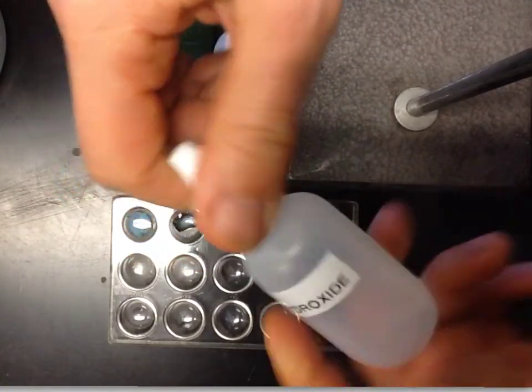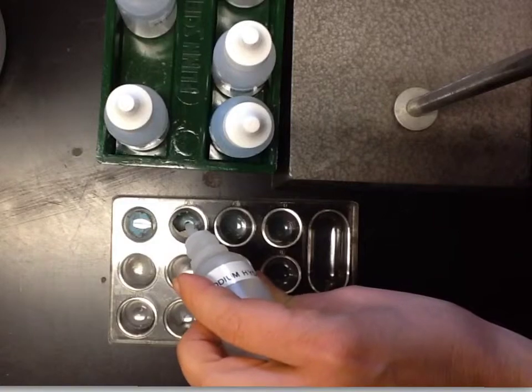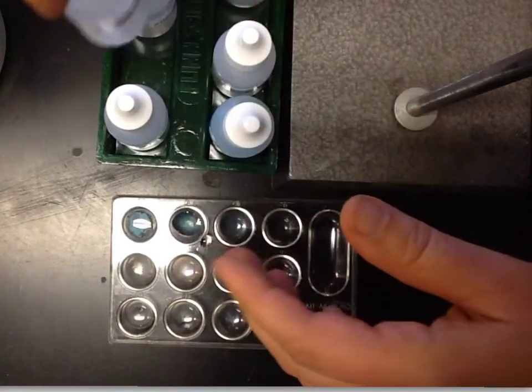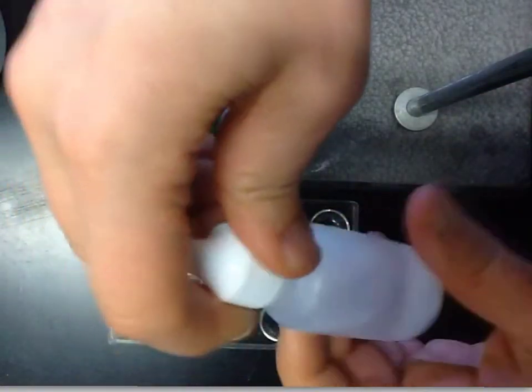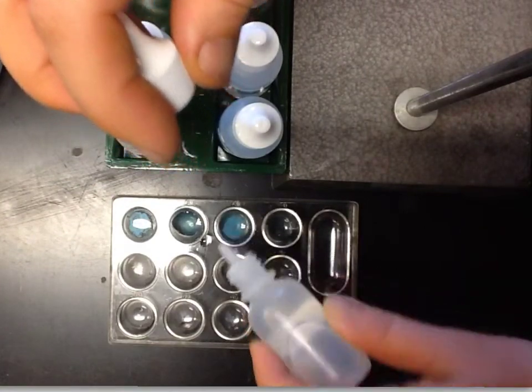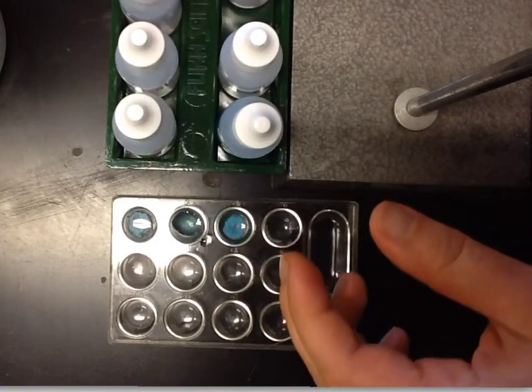Next we're going to mix sodium hydroxide, again with that copper 2 sulfate from the first time. Again, you can see in that one it's not quite as white, but the solution got grainy. Now we have sodium carbonate being put into the copper 2 sulfate. Again, definitely this kind of cloudy milkiness is formed.